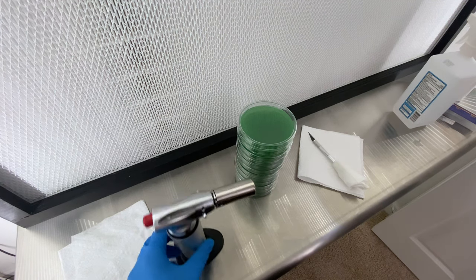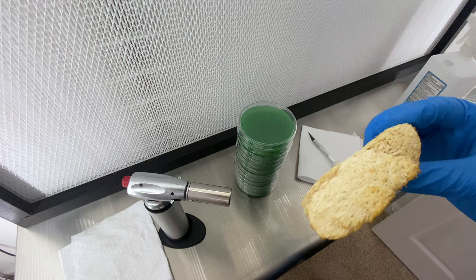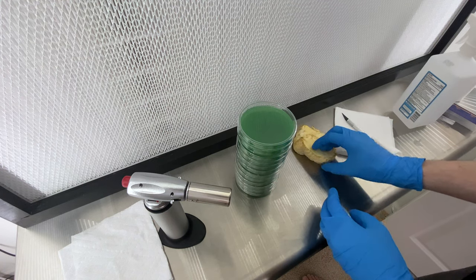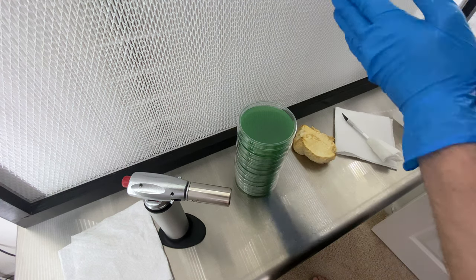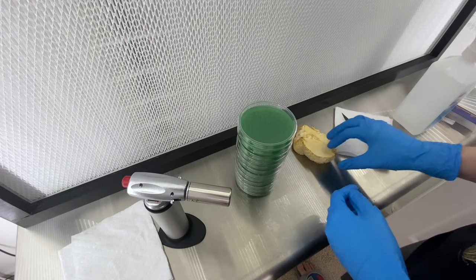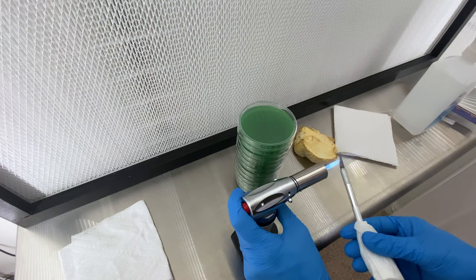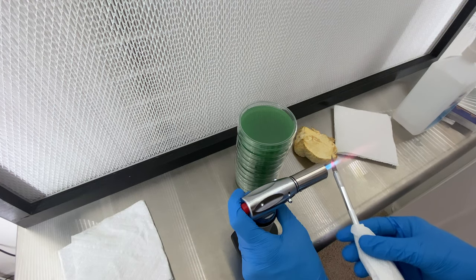The sample of lion's mane I have here is from one I've grown previously — it was one of the best flushes I've had, so I definitely wanted to take a clone of it. I've taken a slice; it's already a little bit yellow from leaving it out in the air, but the inside is very fresh, which is what we're going to be taking our clones from. I'm going to wipe my hands down with some isopropyl to prevent contamination going from one surface to another. You can never be too clean.